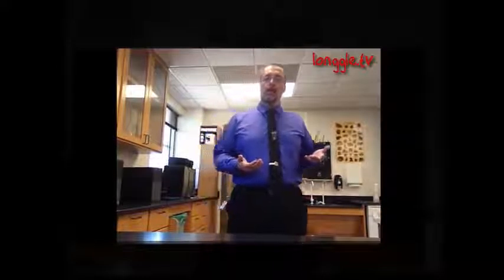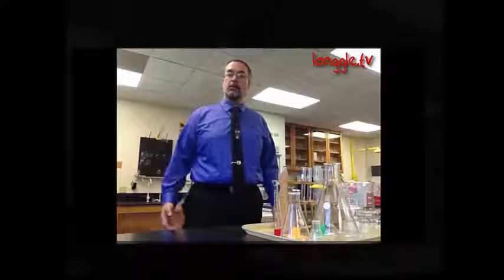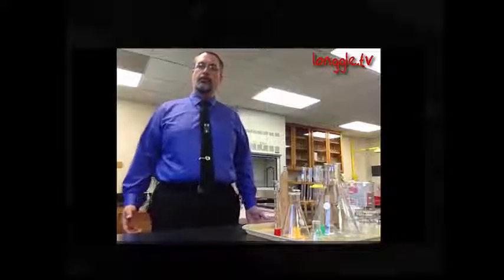I thought we'd take a little bit of time today to take a look at some of the lab equipment that we use, some glassware and some instruments, so that when you take your first lab, you'll be able to understand what the equipment is called. And so I'm going to show you a few of these things and tell you how they're used so that you become familiar with them.